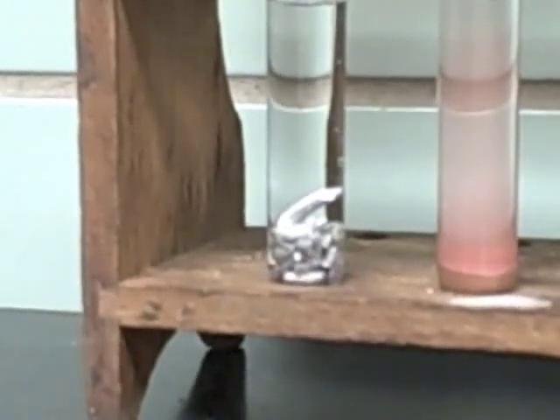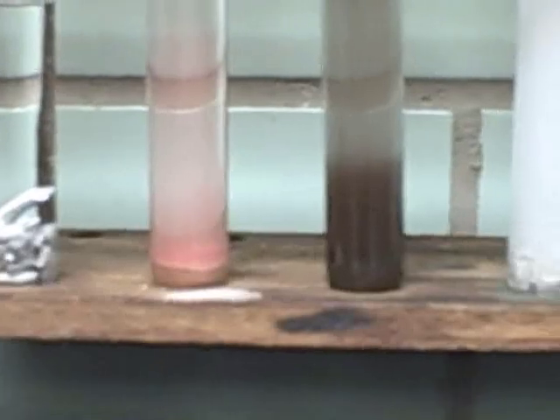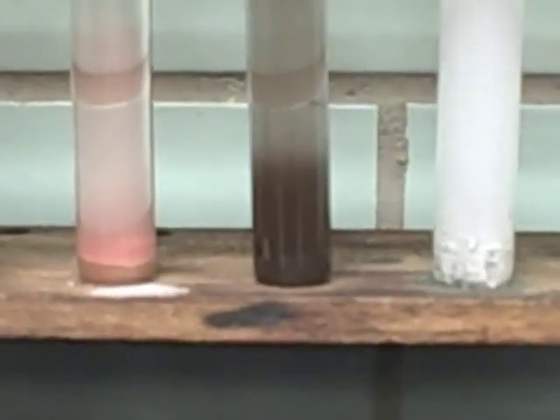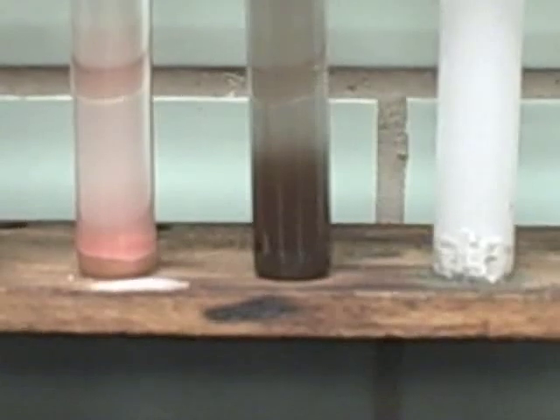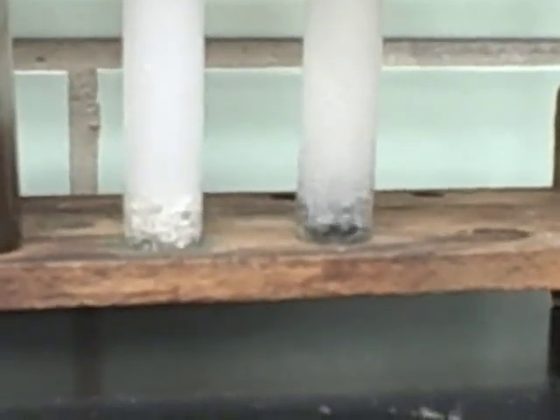You'll see there's a small amount of bubbling in the aluminum, there's no change in the copper, very little change, if any, in the iron, significant change in the magnesium, and also significant reaction in the zinc.